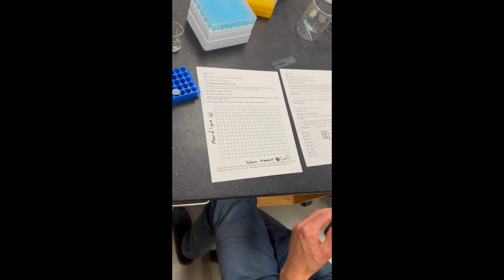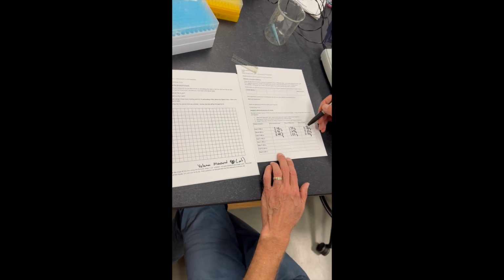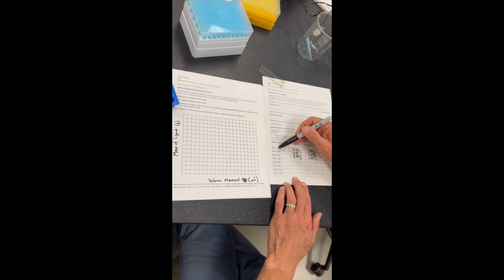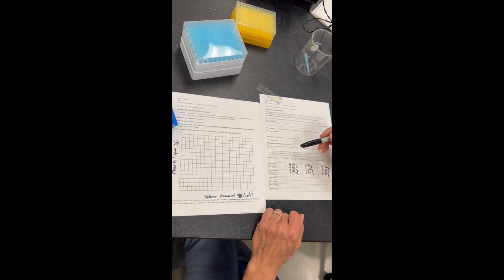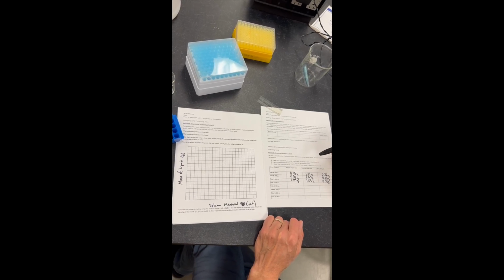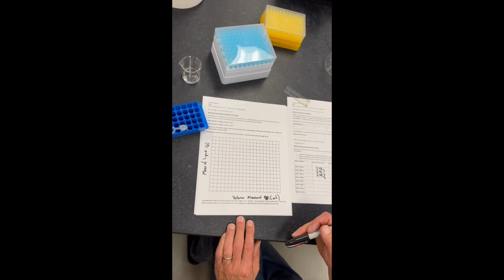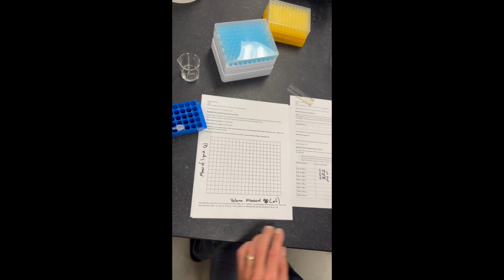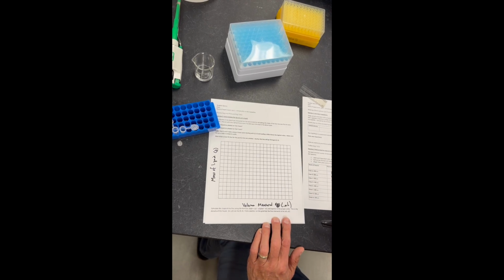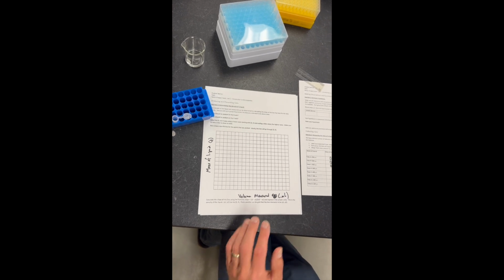Okay. All right, the reason why we're graphing the results is to try to be as accurate as we can on measuring the density. We could theoretically determine the density of the liquid simply by dividing the mass of the liquid by the volume that we measured. And what we want to do is display the graph in what we usually do, grams per milliliter, but right now we have microliters. And so I guess, grams per microliter. We can just do grams per microliter.